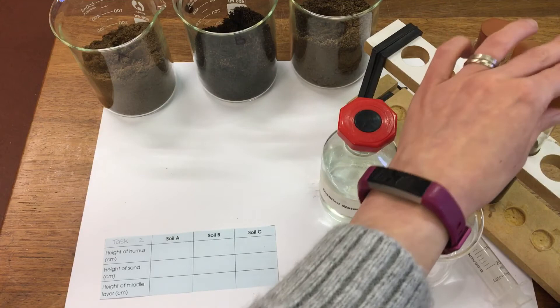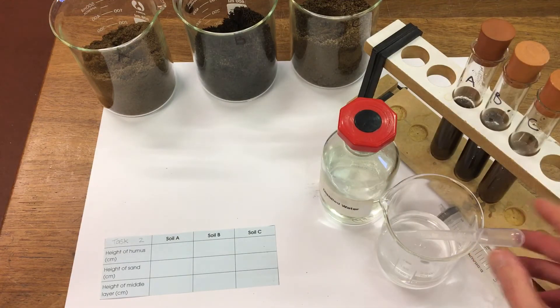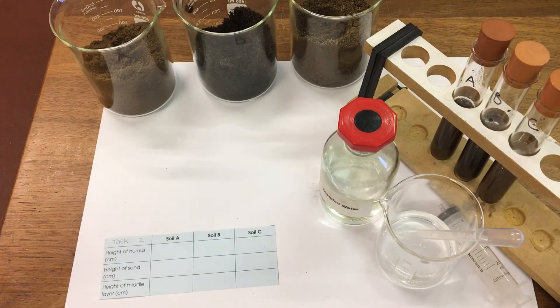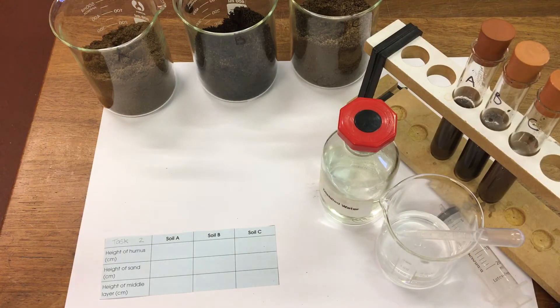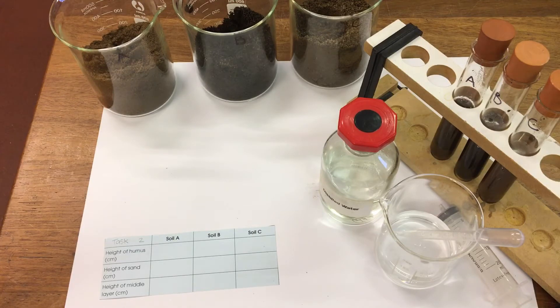These tubes are then going to be left for 20 minutes and we're going to come back and measure and see the content.